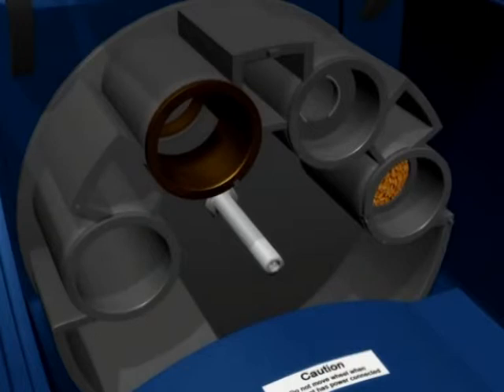All sample cells have the same notch in the rim of the cylinder, which guides correct positioning of the cell in the sample handling wheel. Make sure the cell clicks into place with the matching pin.